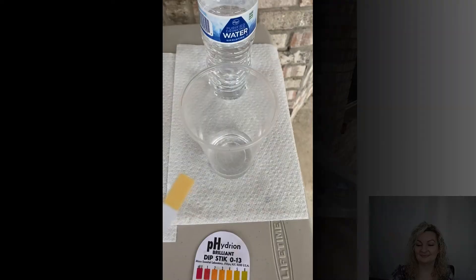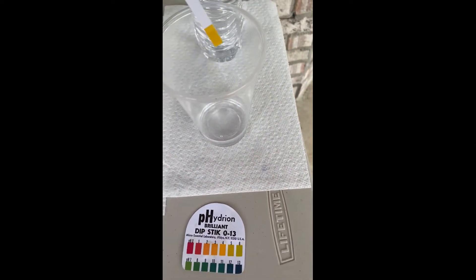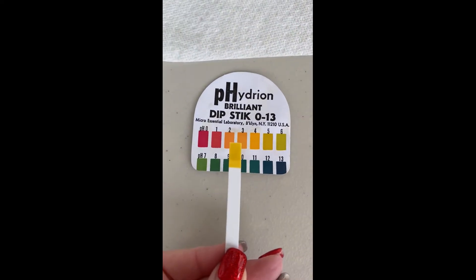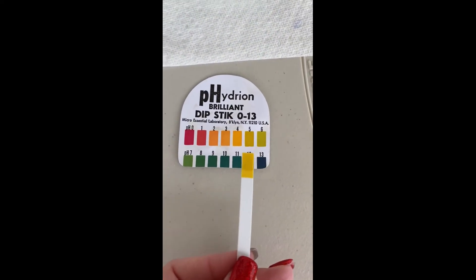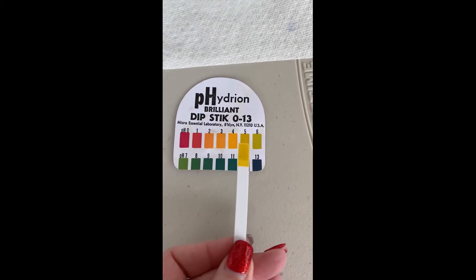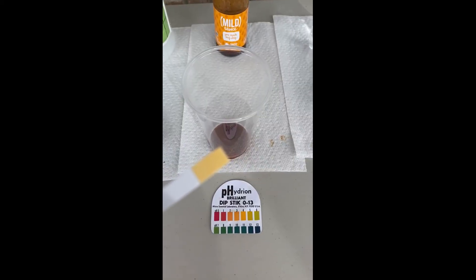So we're going to go ahead and start with water. Stick your pH paper in the substance that you're testing, and give it a second to start turning colors, then compare it to your swatch to see which one it best aligns with. This one was somewhere around a 5 to a 6 maybe, somewhere in there.